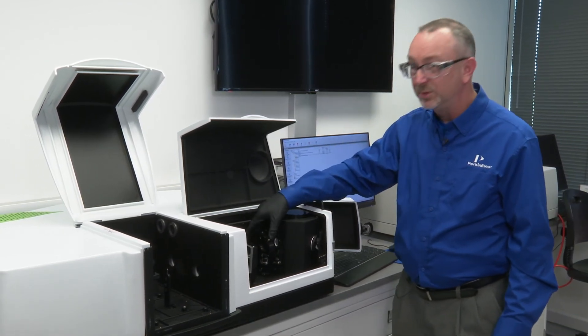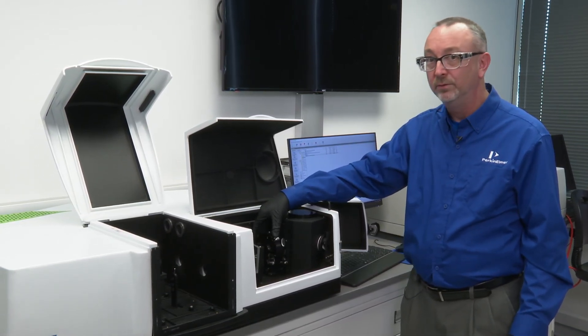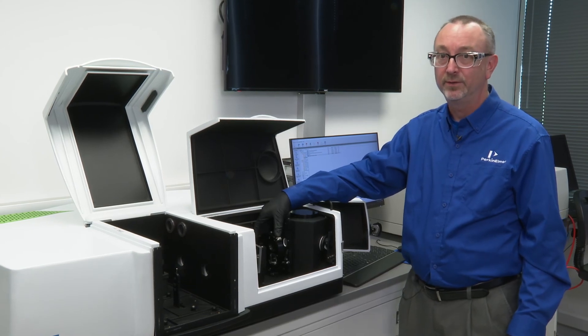Small spot kit, a critical component of the 150 millimetre integrating sphere.